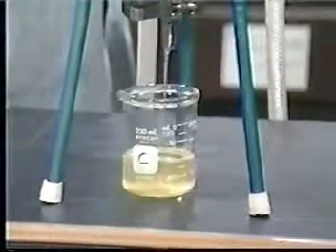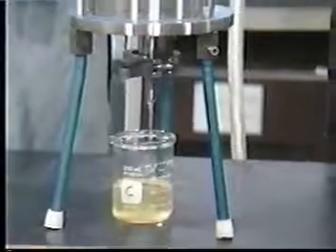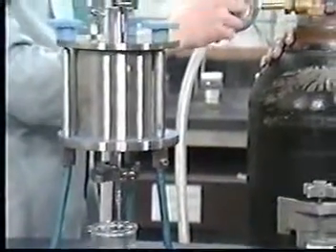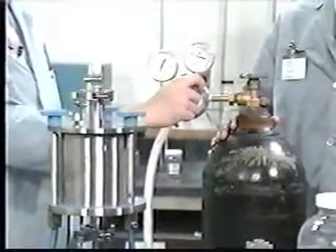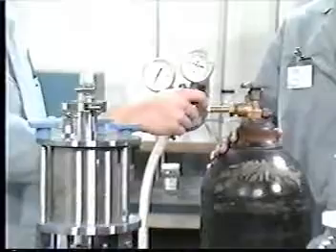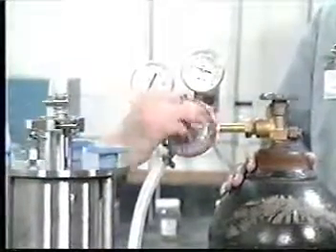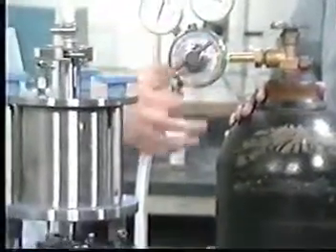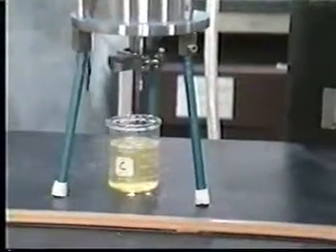Collect filtrate using 1 to 10 psi until the pressurizing gas passes through the filter, indicating that all liquid has been removed. If no additional liquid appears in any 2-minute interval, slowly increase the pressure in 10 psi increments to a maximum of 50 psi. Filtration is stopped if at any time the gas begins to move through the filter or when 2 minutes have elapsed at 50 psi with no additional liquid appearing.